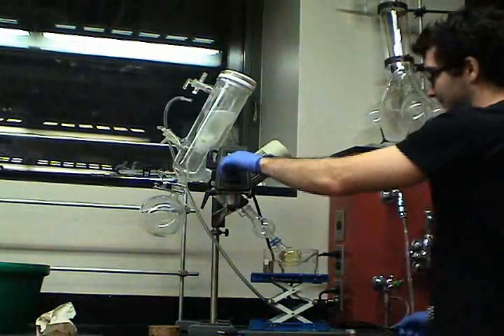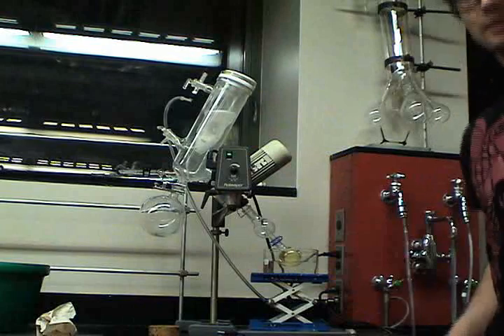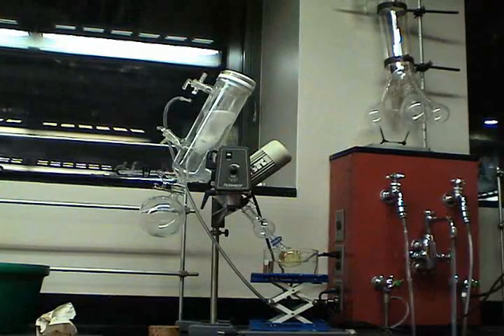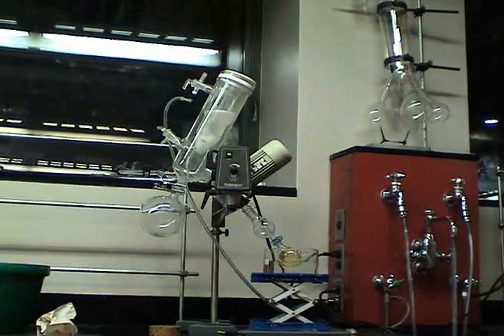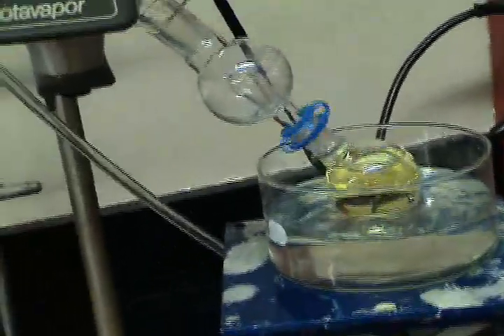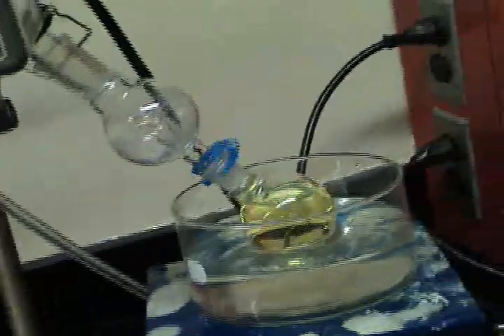And our flask here, and the solvent in it, should start boiling. Remember what I said about it being too full. It'll probably bump.